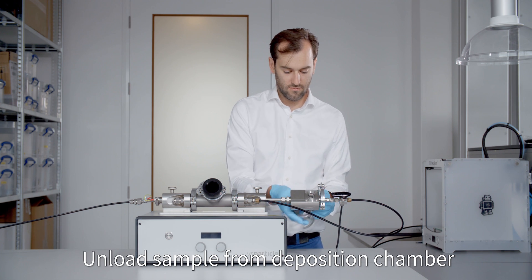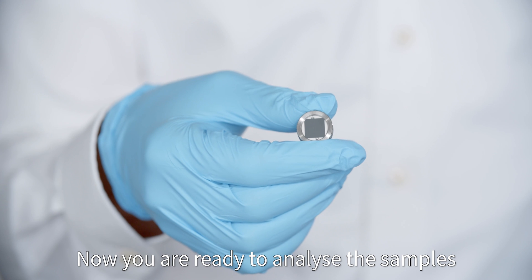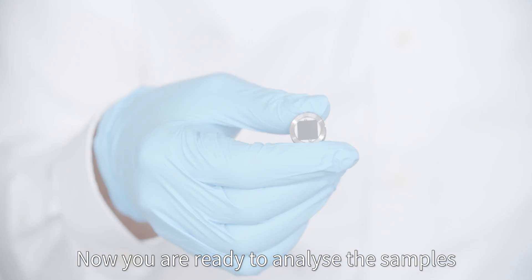Unload sample from deposition chamber. Now you are ready to analyse the samples. Thank you.